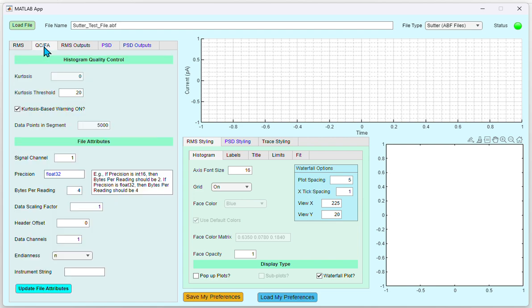Under File Attributes, you can see all the relevant binary file attributes. This includes the signal channel, the precision of the recording, bytes per reading, data scaling factor, header offset, data channels, endianness, and instrument string. More information about the instrument string can be found in the compatible file type document included with this app. By default, we set the signal channel to 1. By this we expect the current readings to be in channel number 1. If this is not the case, this should be changed.